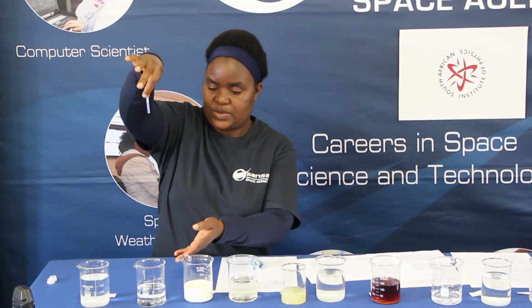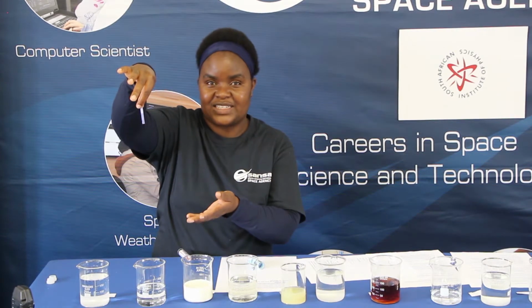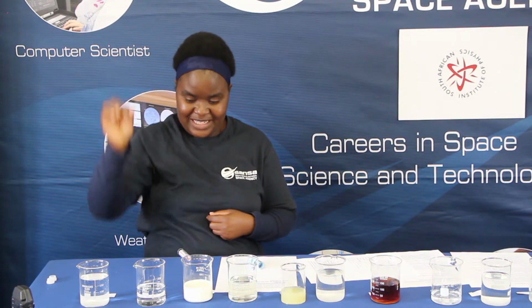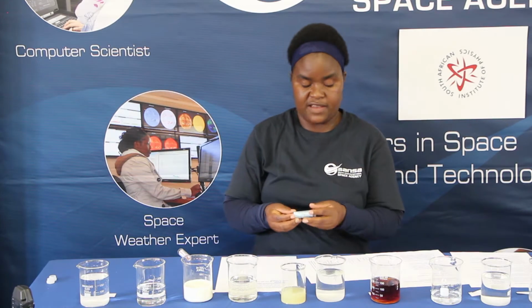It remains blue. So what does this tell us about this water that we have? Is it an acid? Is it a base? Or is it a neutral? Can you guess the answer? I guess you can tell me the answer, right? We're going to go to the next one, which is vinegar.